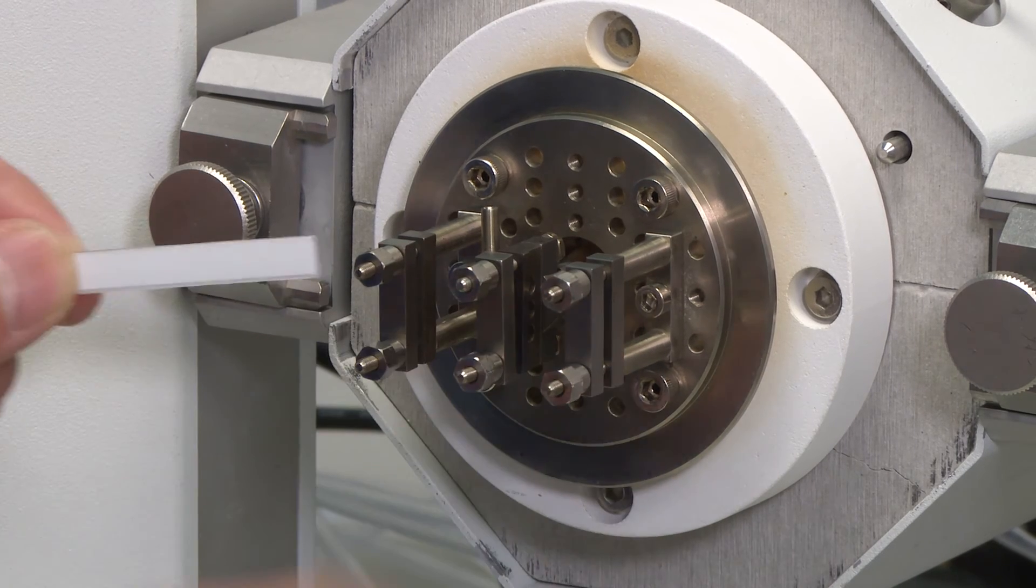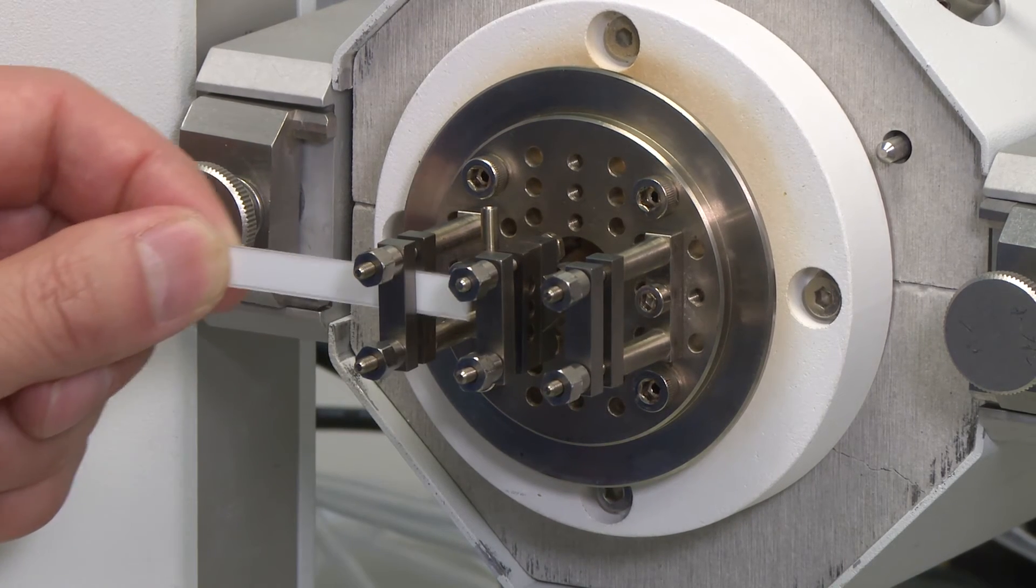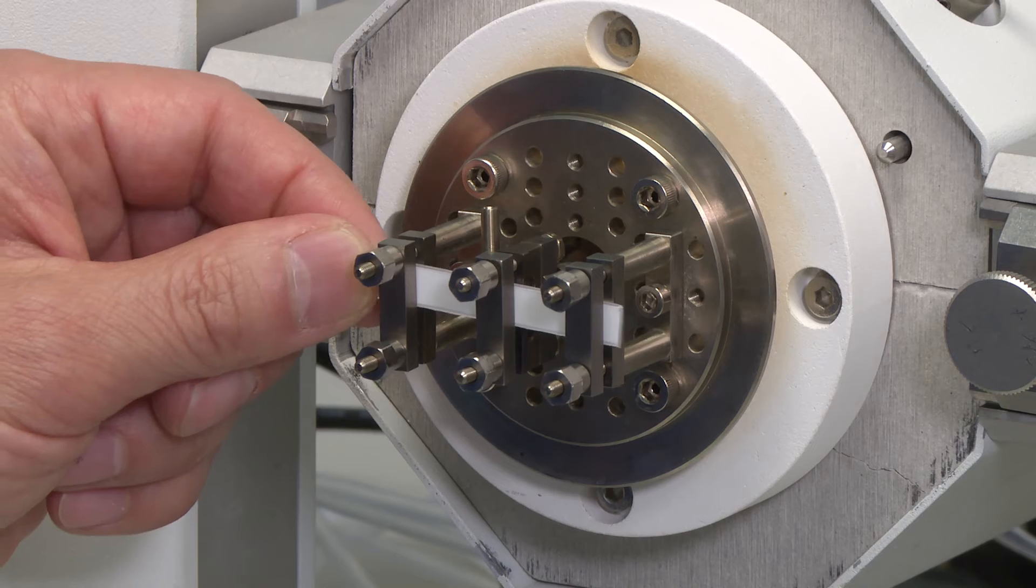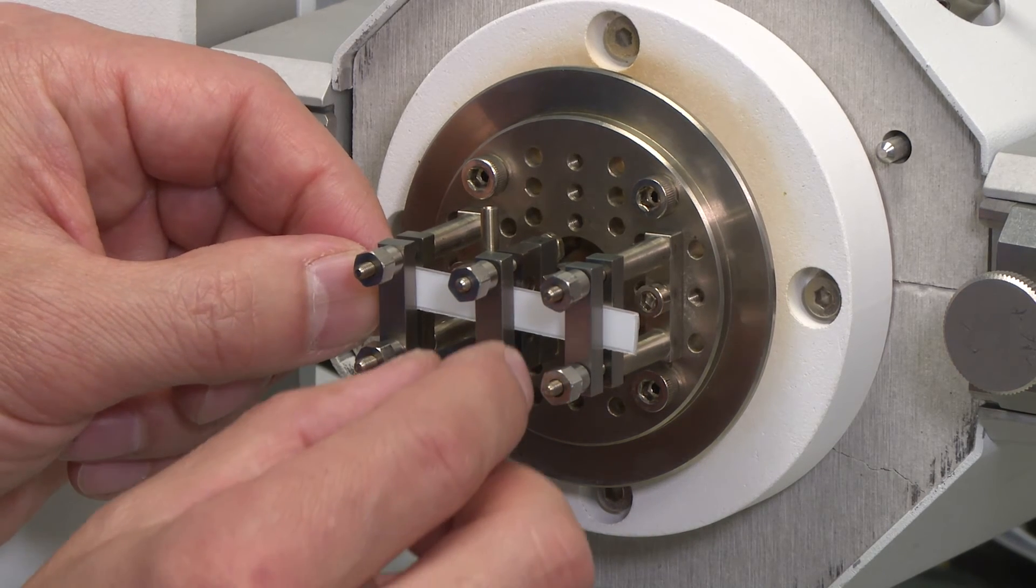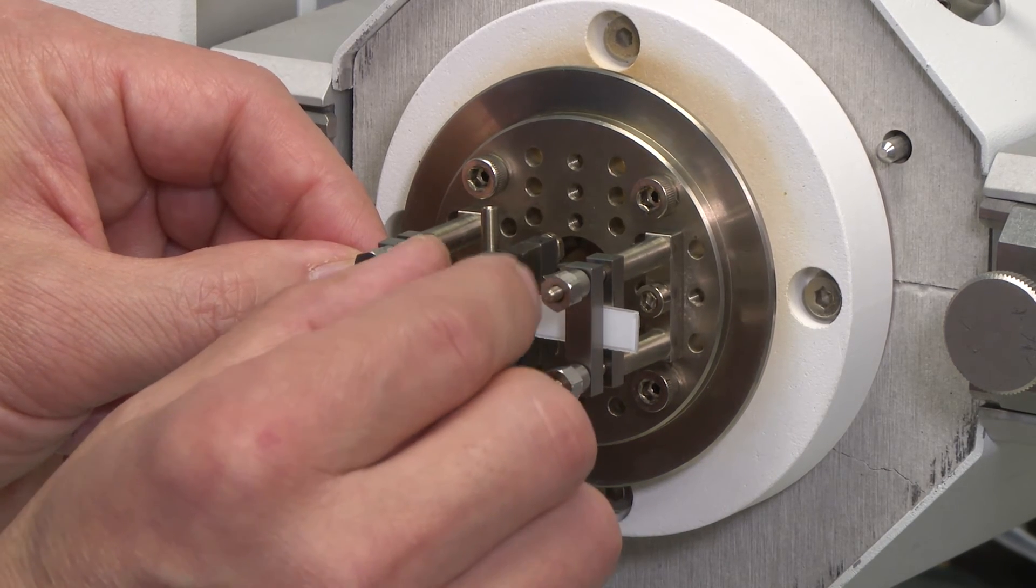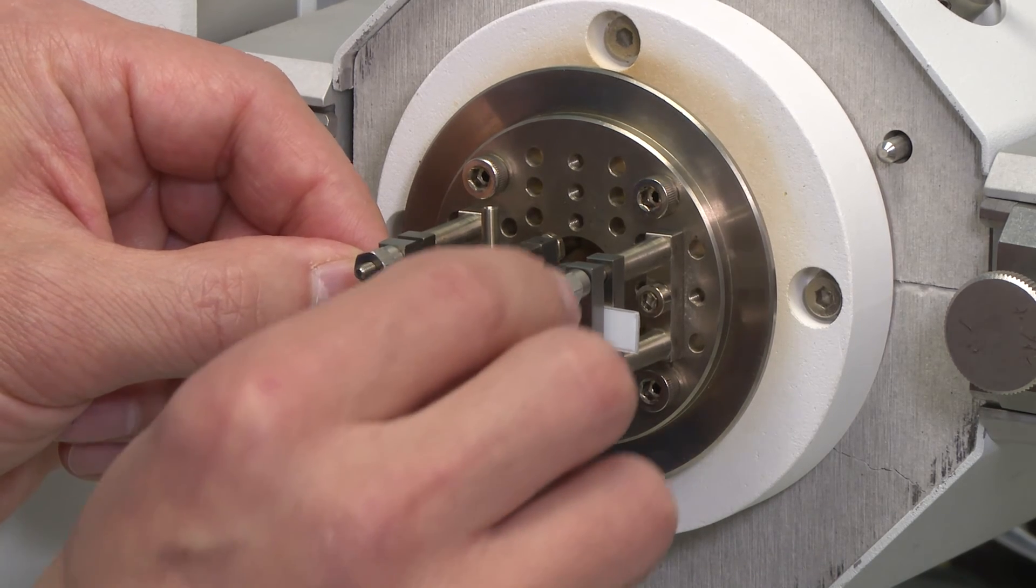You can loosen these nuts and slide the sample in.